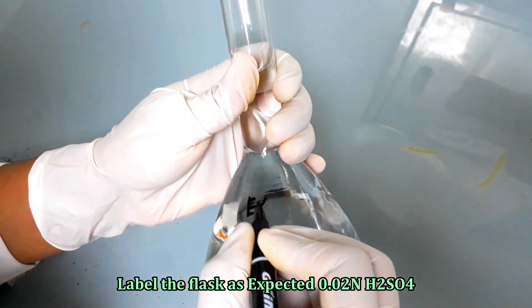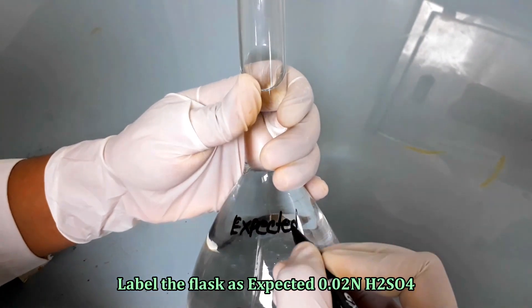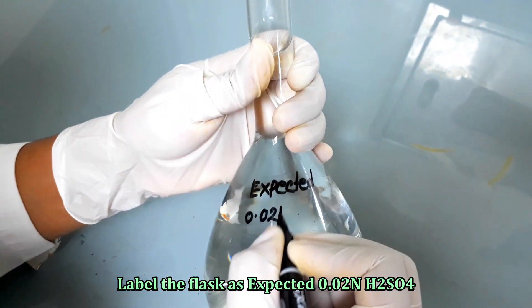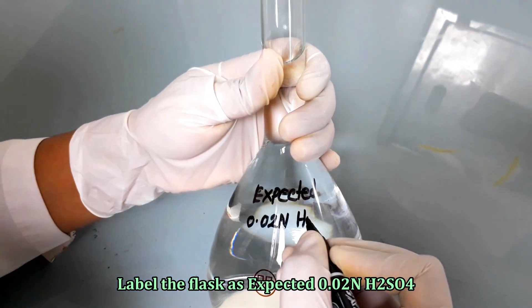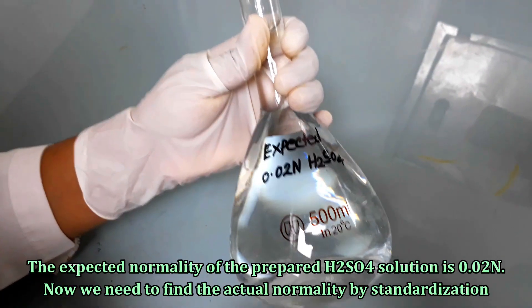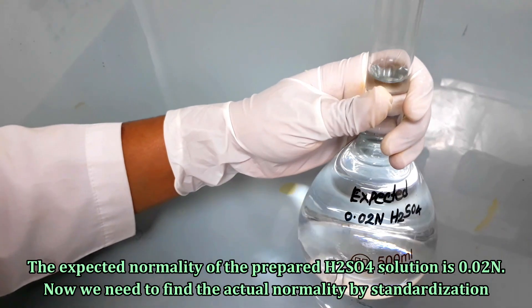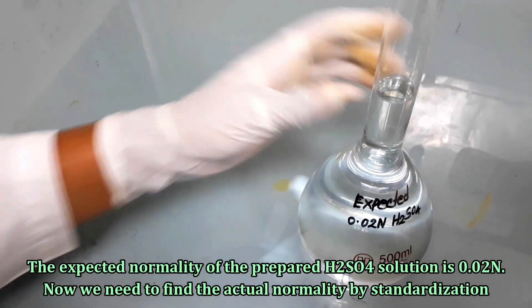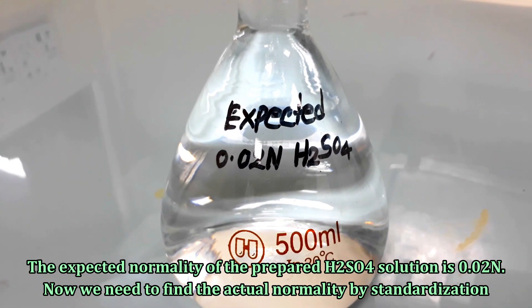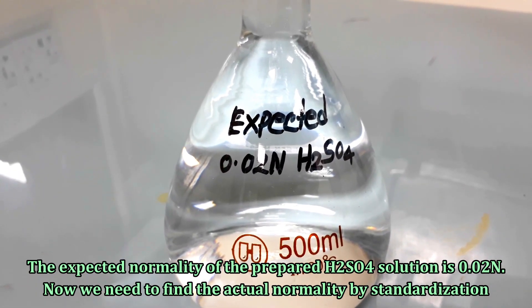Label the flask as expected 0.02 normal sulfuric acid. The expected normality of the prepared sulfuric acid solution is 0.02 normal. Now we need to find the actual normality by standardization.